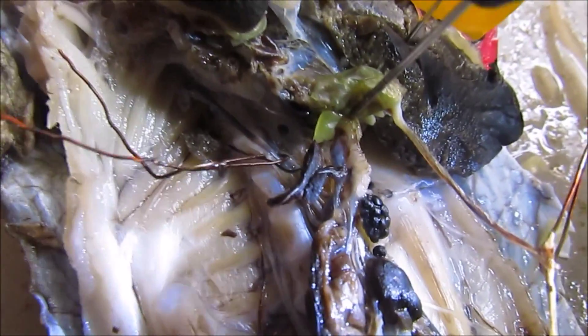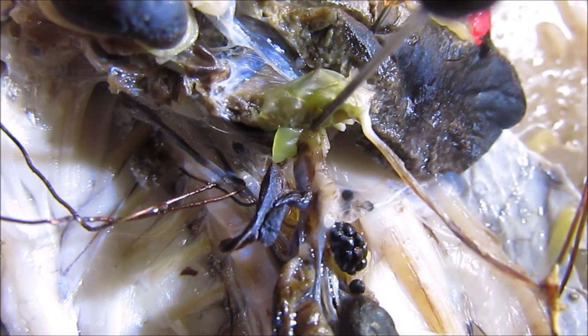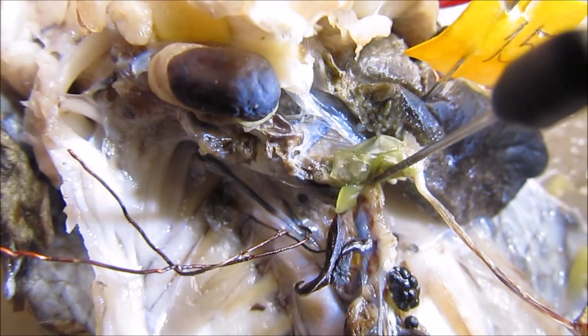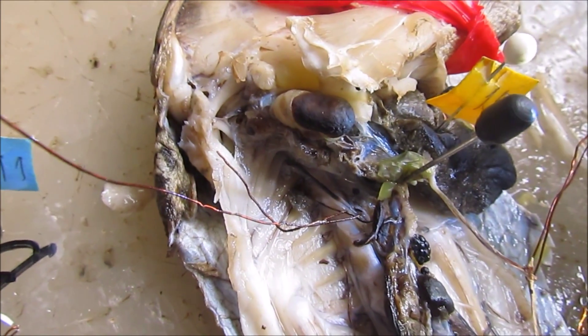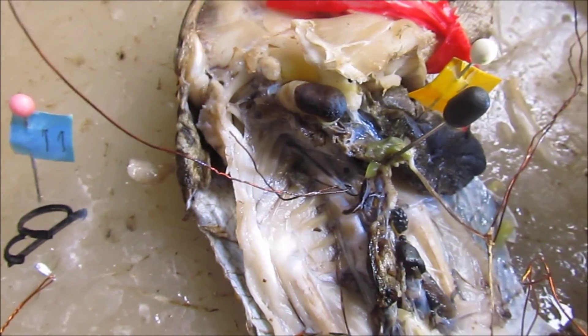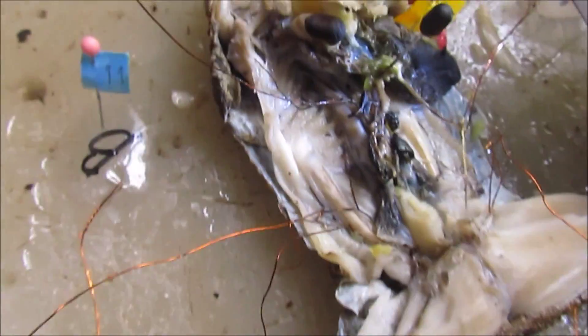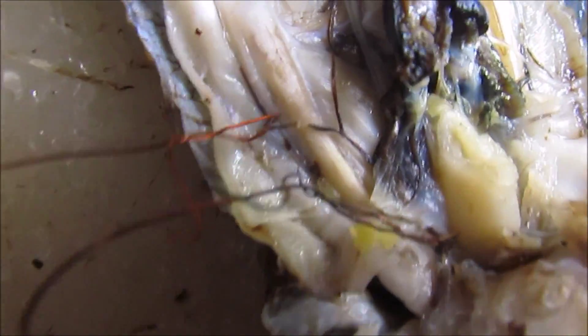This is the renal portal vein. Then next is the dorsolumbar vein. Where are you? Near the lumbar vertebra, near the lead.